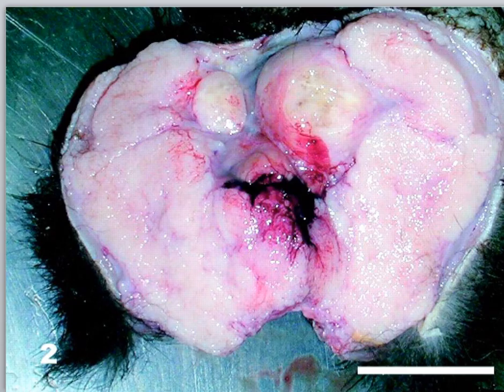The tumor itself, when cut in half, has a nodular appearance. You could see in areas it's separated by bands of fibrous tissue. And here you could see that it's hemorrhagic in the middle, but for the most part all of this white fleshy material is tumor, and the bulk of the tumor itself looks like it is not separated by fibrous tissue, which is very typical of lymphomas and many other non-lymphoma quickly growing neoplasms.